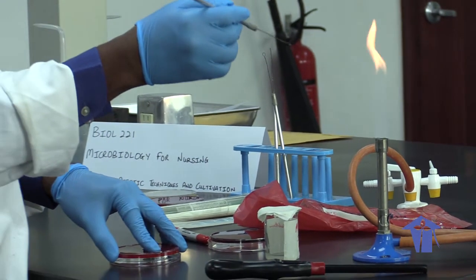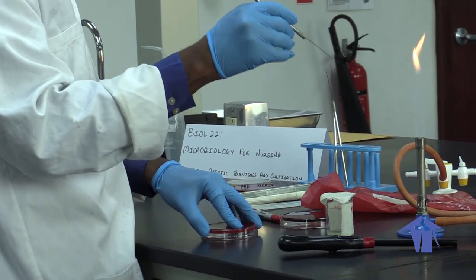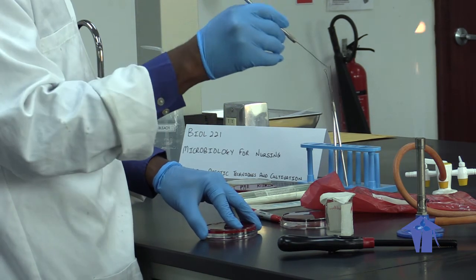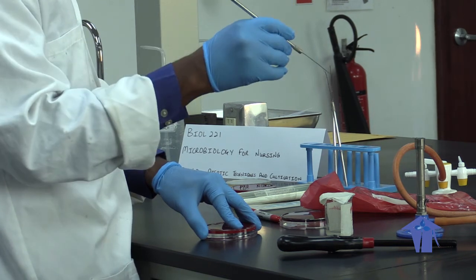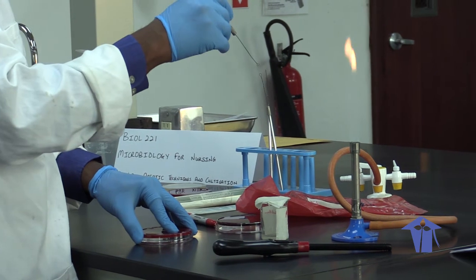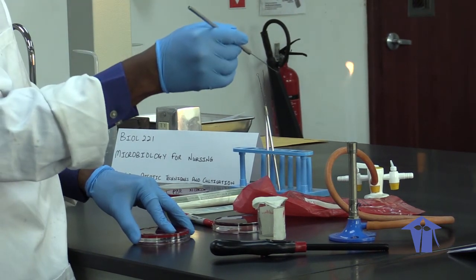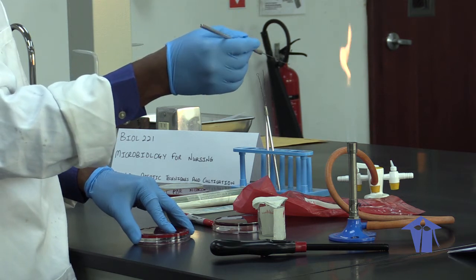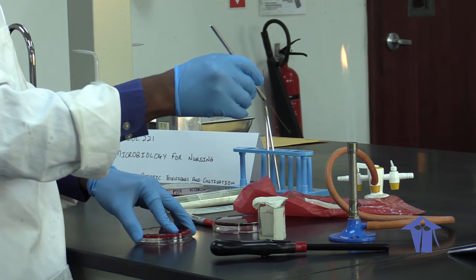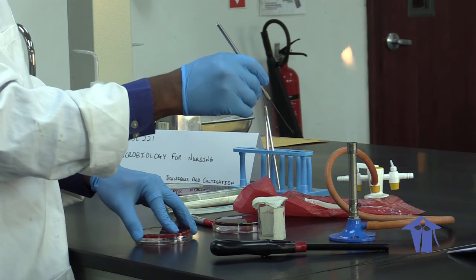Then you sterilize your loop again by flaming. This causes a decimal reduction in the number of cells per unit volume as we streak along the plate, streaking each quadrant. By the last quadrant of the plate, if we had a thousand colony forming units per milliliter, by the last quadrant we have one colony forming unit per milliliter. When we have one CFU per milliliter, we'll be able to see the true morphology of these microbes.